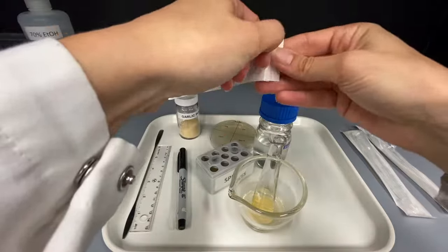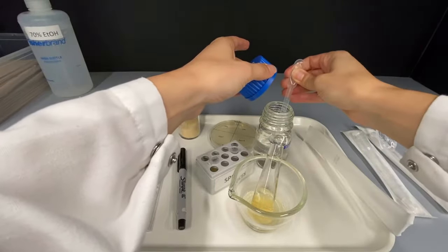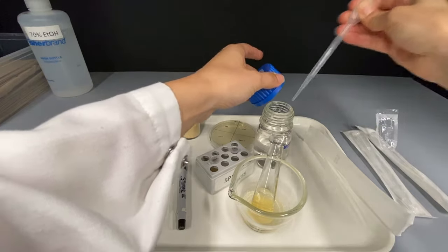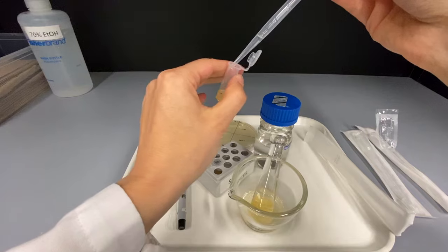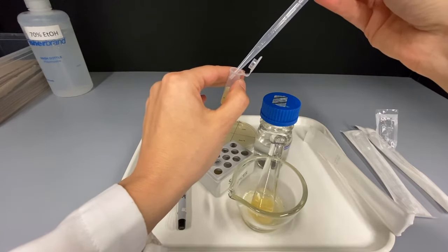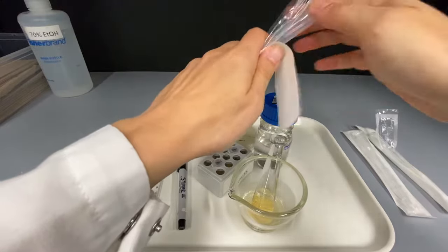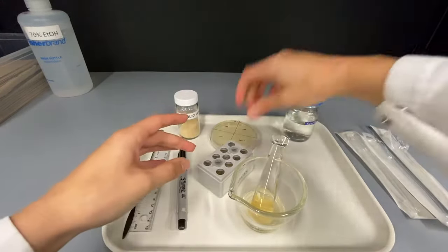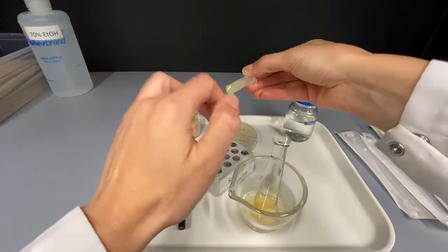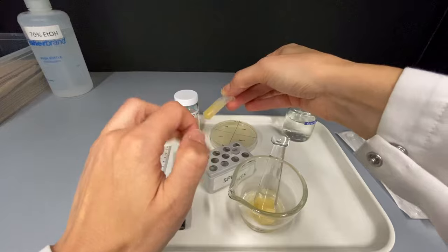Using a clean plastic transfer pipette, add 0.5 ml of sterile water to the tube labelled Gar-2 to make a 1 in 2 dilution. Mix the Gar-2 solution well. Gar-2 is now half the concentration of Gar-1.